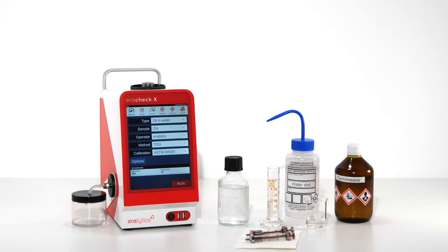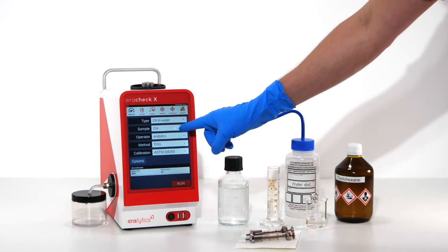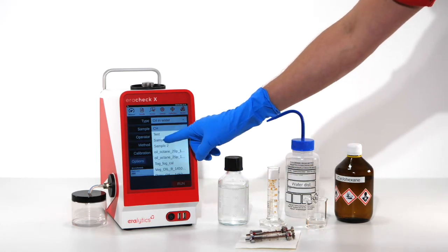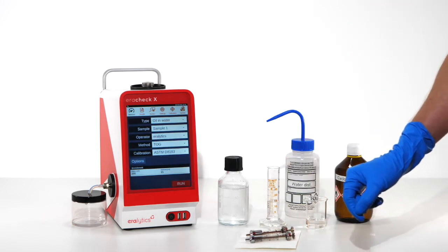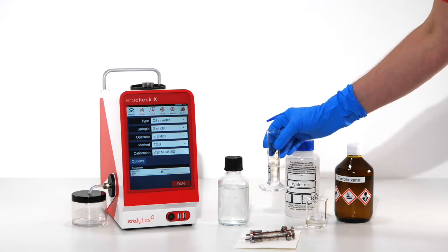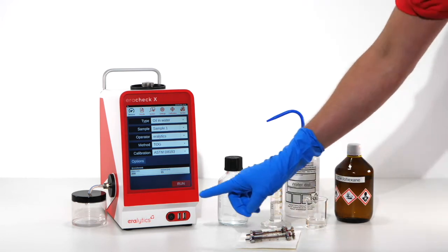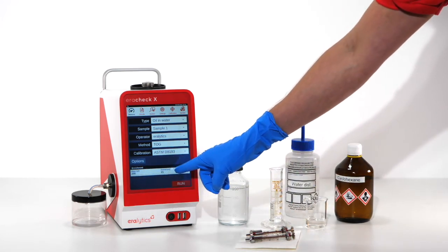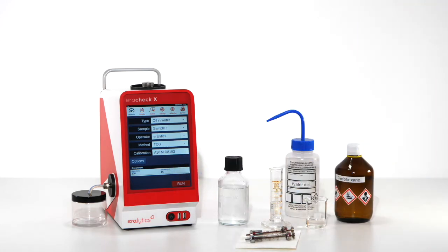Measurement. Enter the operator and sample ID or choose it from the list. Prepare 15 ml of fresh cyclohexane in the small graduated cylinder. Specify the sample volume and the volume of cyclohexane used for the extraction on the screen.